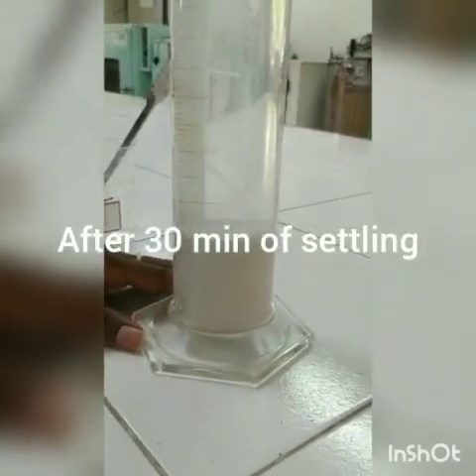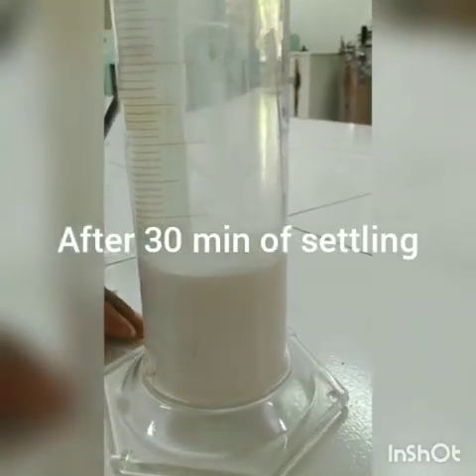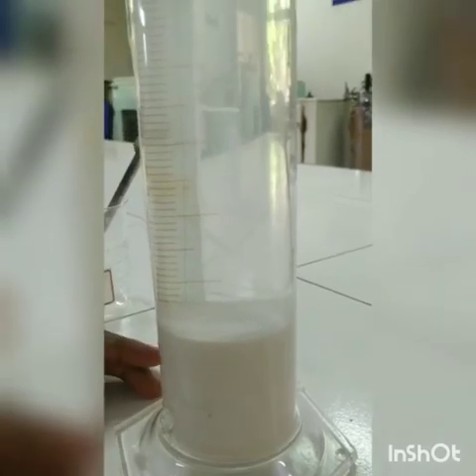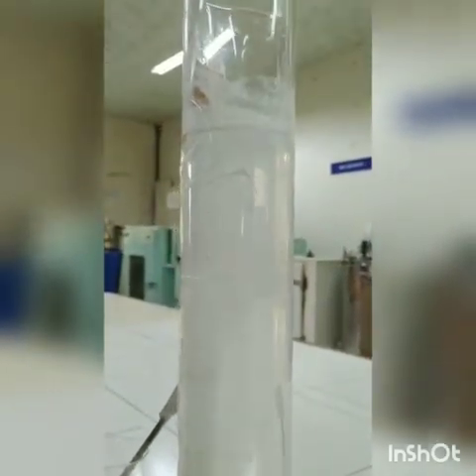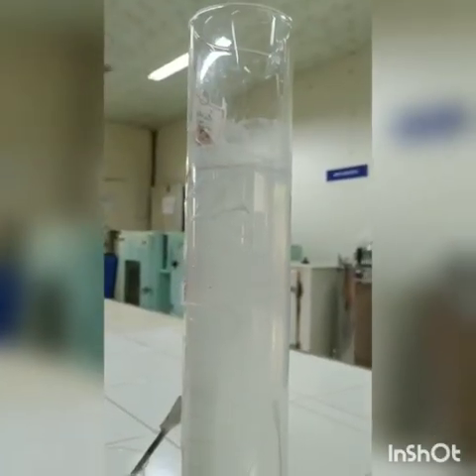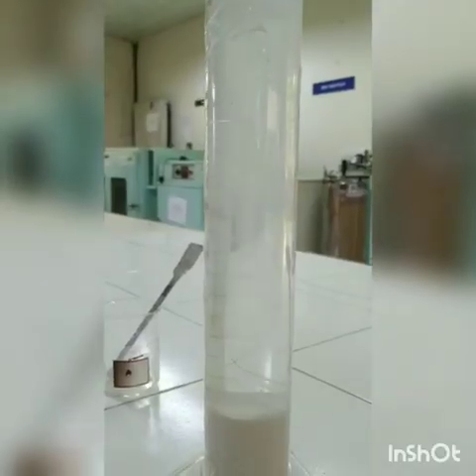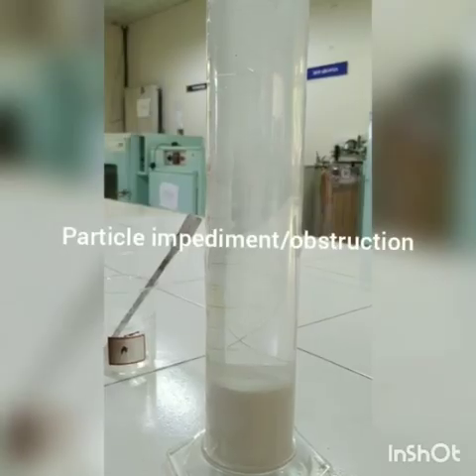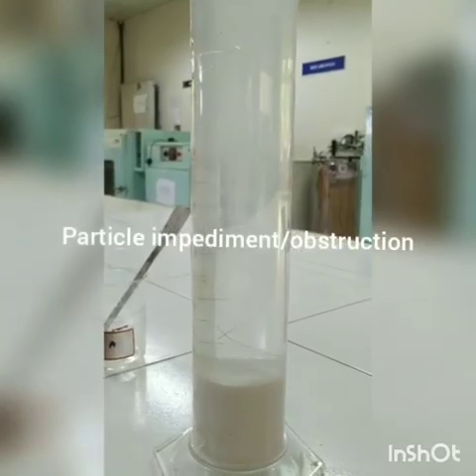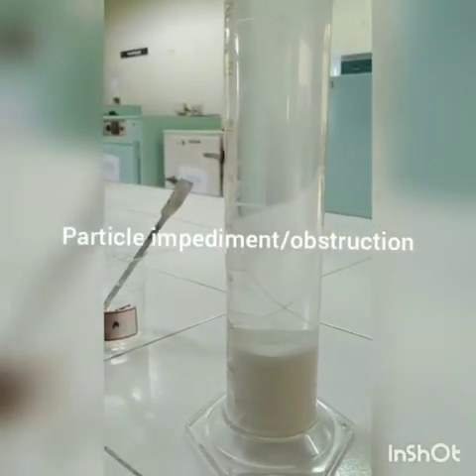As I told earlier, if you leave the measuring cylinder for some time, the compression zone forms at the bottom of the cylinder, which means that all the particles have started to sediment and reach the bottom. Still there are some smaller particles floating. That might be due to the lesser density, and sometimes impediment happens because a particle will impede the other particle from sedimenting.